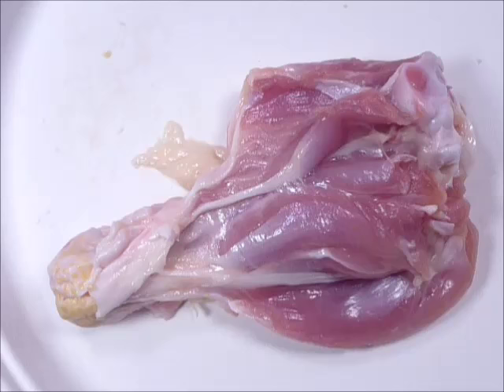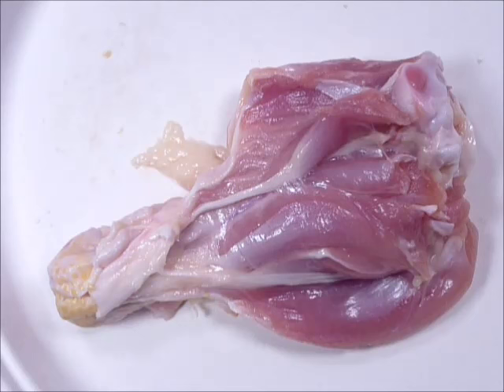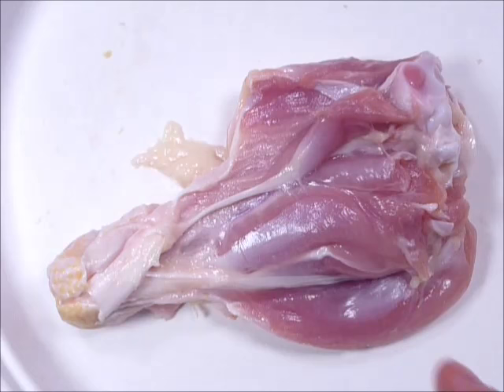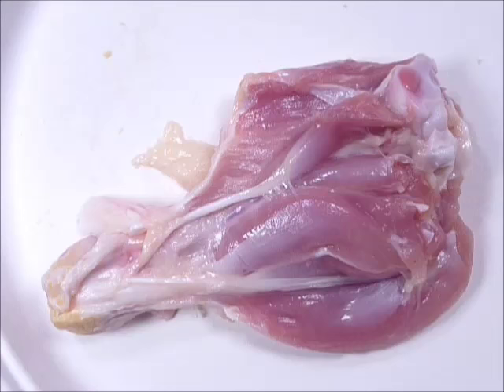So we found loose connective tissue on the underside of the skin. We found adipose. We found regular dense — the tendons and ligaments, all parallel and really strong. And we found irregular dense, which is all these bags everywhere and also the bottom layer of the skin. All these tissue bags are the irregular type.